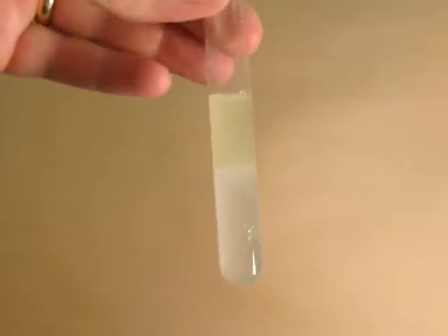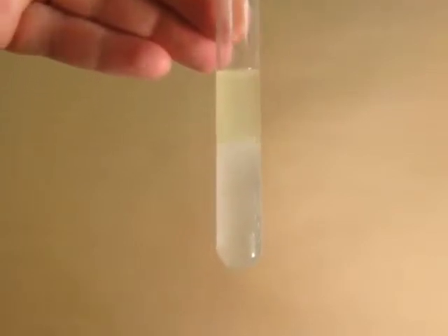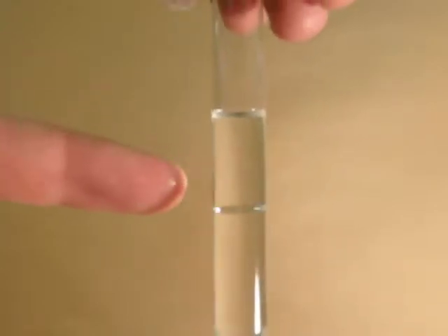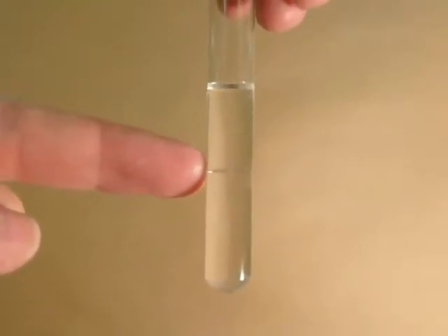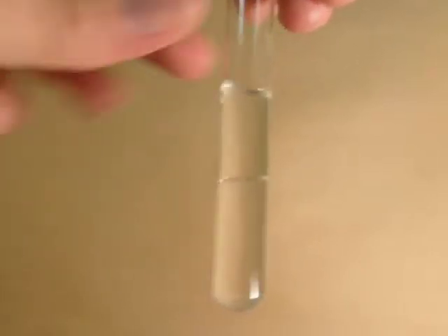Okay, so looking at the first one here we have water and oleic acid, which is the primary component of oil, vegetable oil. Definitely some layers forming, so you could record N for no, they do not mix. The next one, this is butyric acid and water. I see no layers there, so you could record Y for yes, they do mix. And then the third one is butanol and water. And you can see that there's a line in the middle right there where the 2 layers are separated. Sometimes you have to look really close for it. So clearly these are not mixing. So I would record N for not mixing.